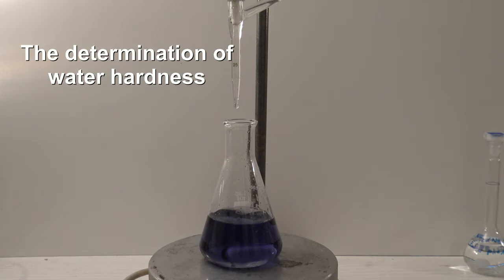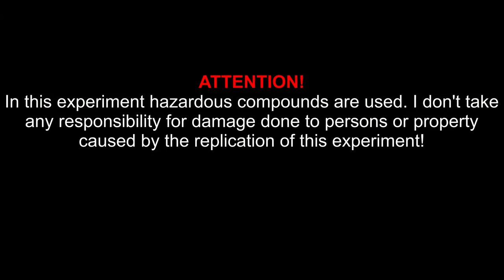The Determination of Water Hardness. Attention, in this experiment hazardous compounds are used. I don't take any responsibility for damage done to persons or property caused by the replication of this experiment.